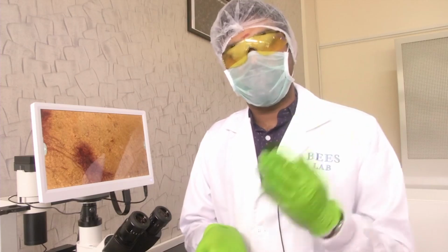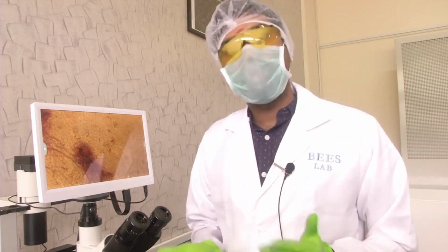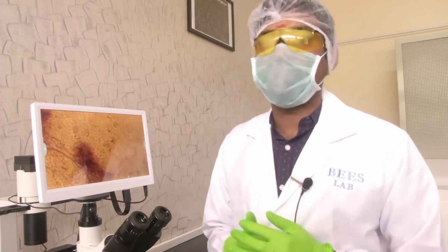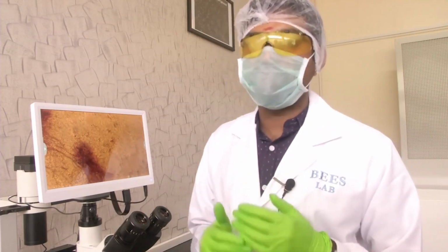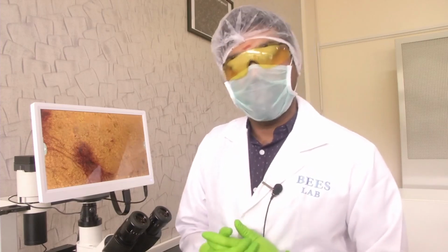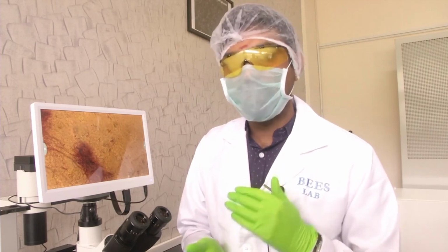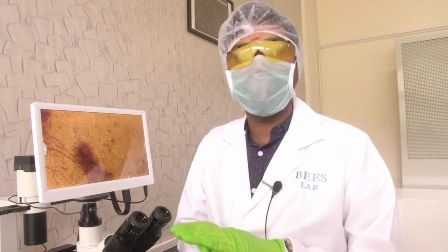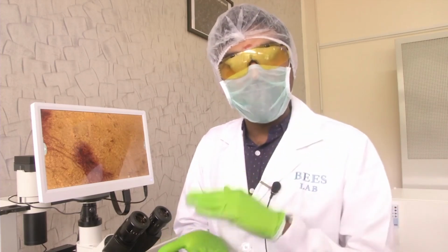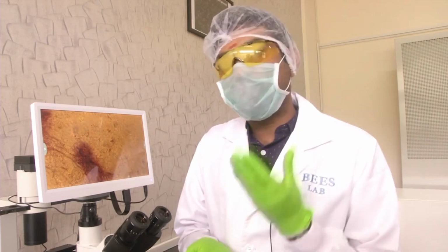The dish can be of any height. It can be a small 5 mm height dish, or it could even be a flask. There are different types of flasks that are available. They are called T25 flasks, T75 flasks, etc., depending on their sizes. In all these we can culture cells, but even here the cells will go and settle at the bottom and attach to the bottom surface of the vessel or the dish in which we are culturing the cells.